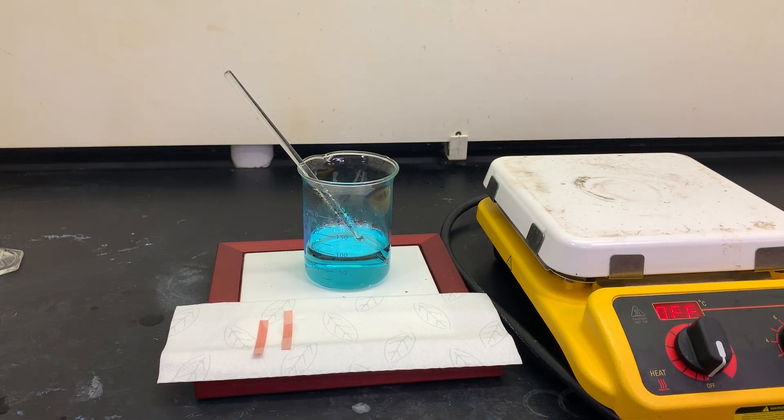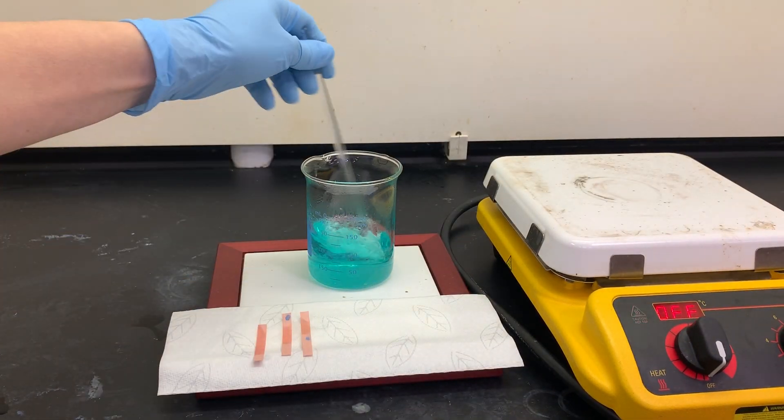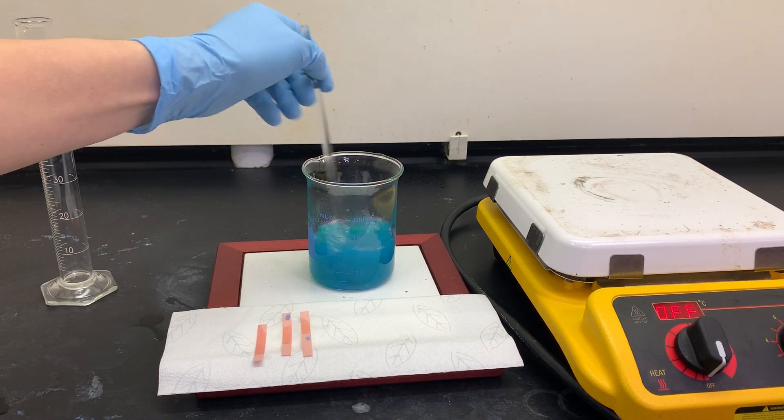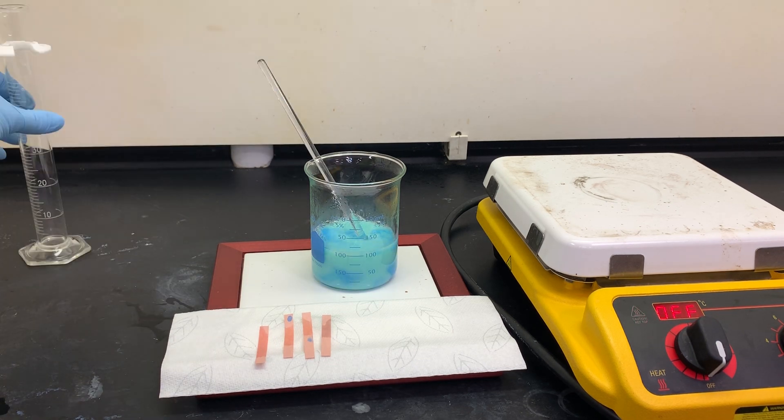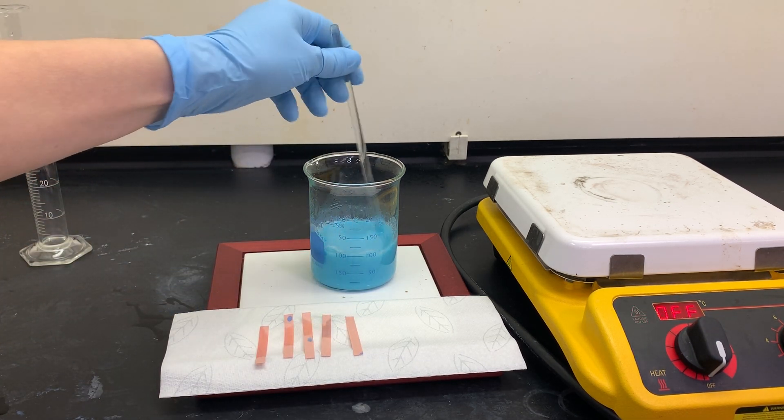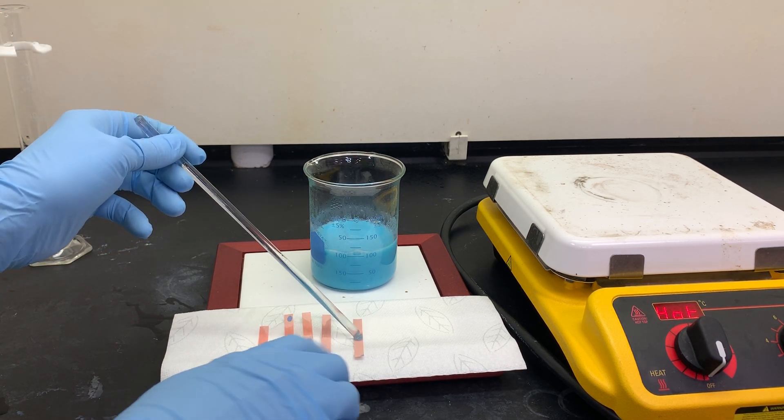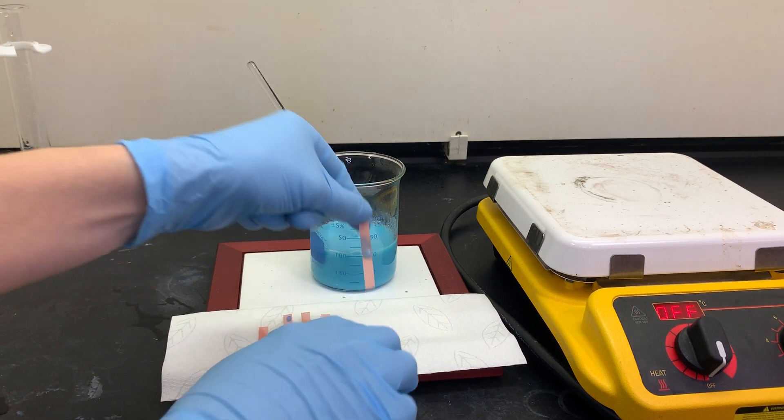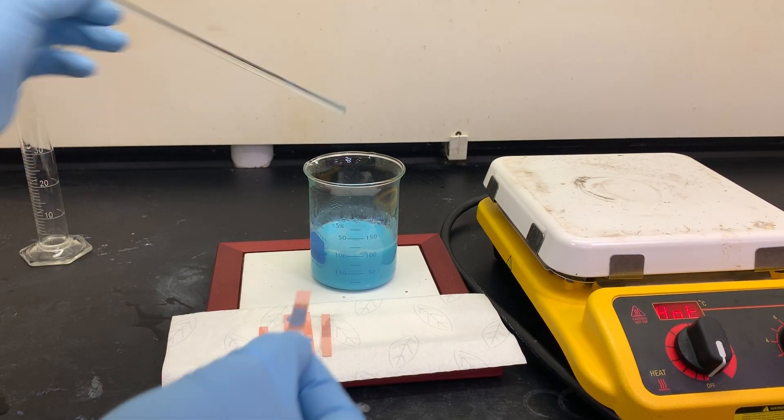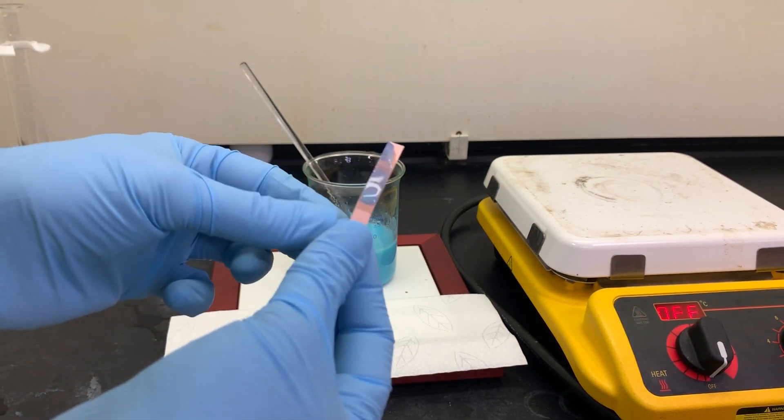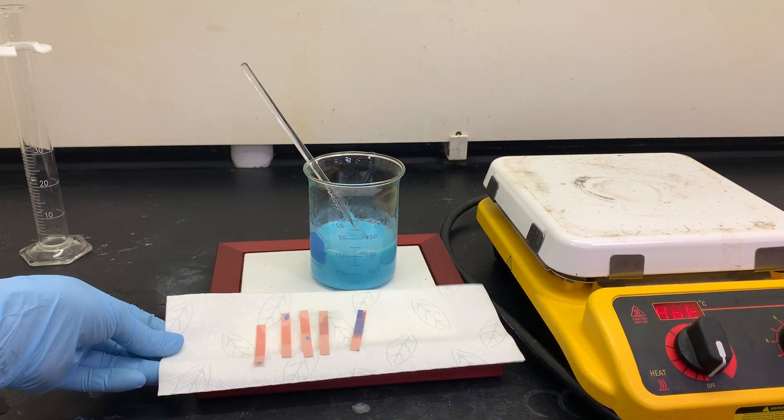We're going to keep adding small amounts of sodium hydroxide until this solution becomes basic. We don't want to add too much, otherwise we'll have to add a lot more acid later on.